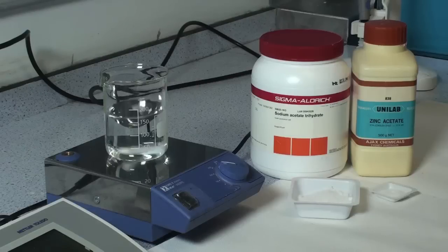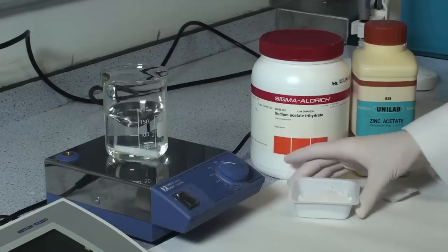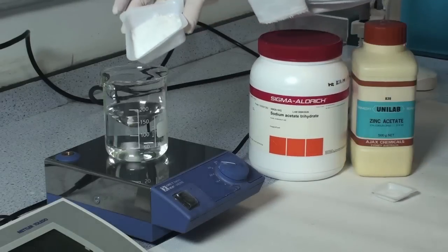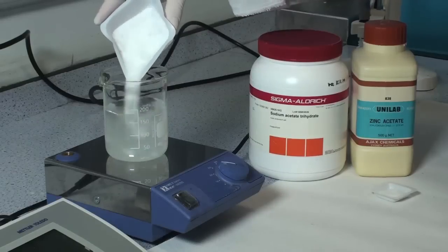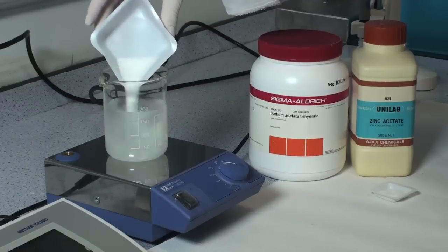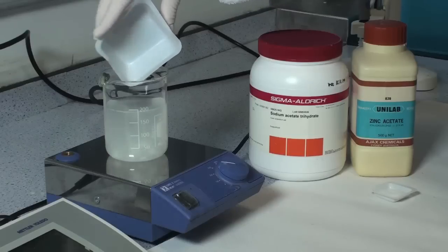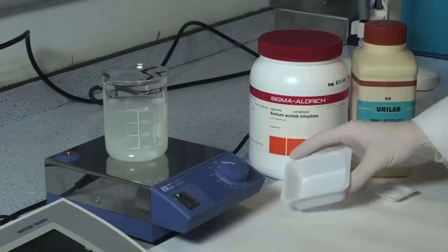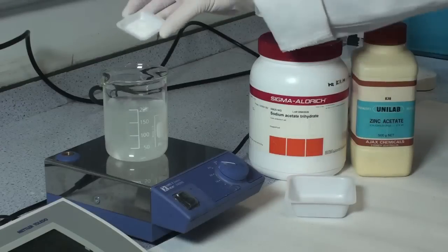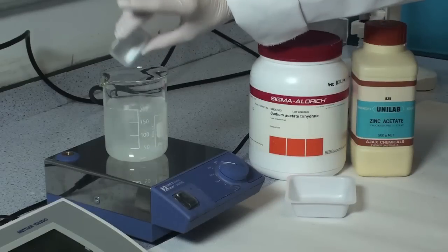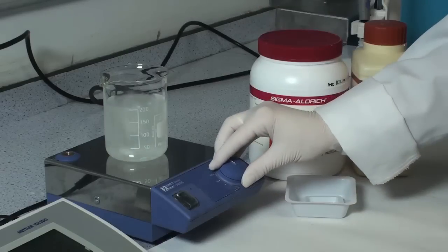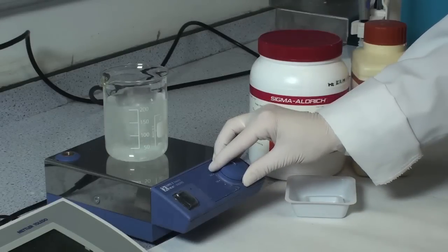Dissolve 40 grams of sodium acetate trihydrate and 4 grams of zinc acetate dihydrate in 150 mls of demineralized water. Stir the solution until these completely dissolve.